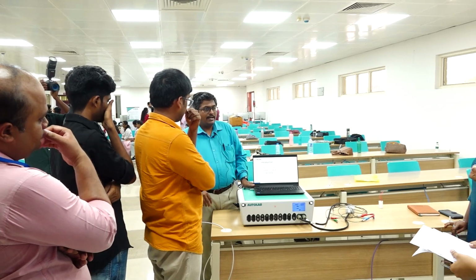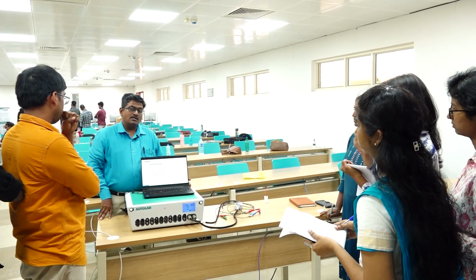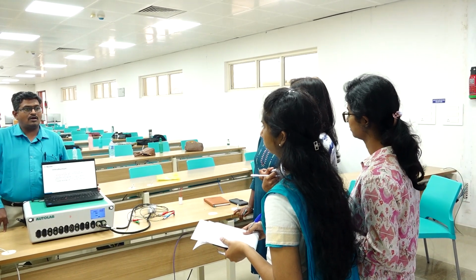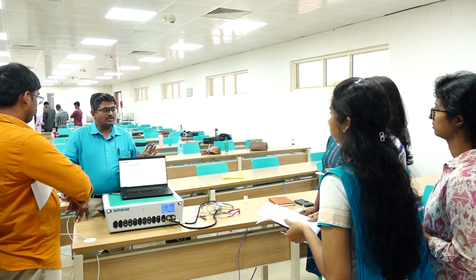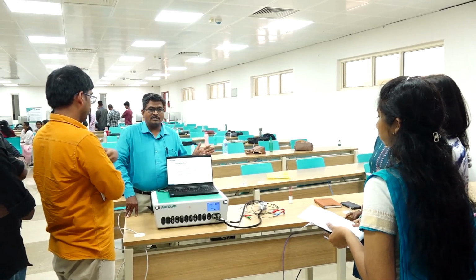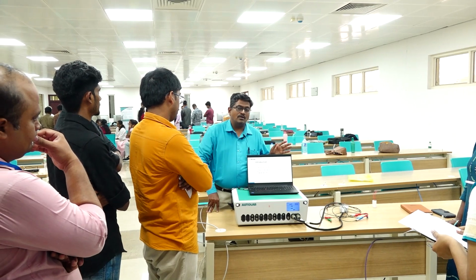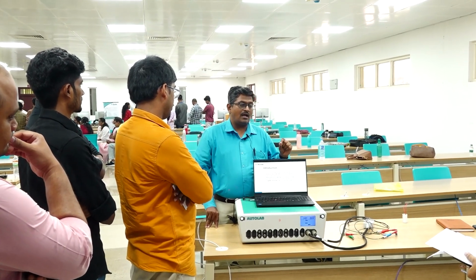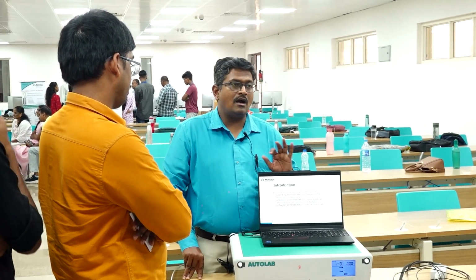So, how do we study this reaction? We need an electrochemical cell. This electrochemical cell consists of a 2 electrode, 3 electrode or 4 electrode setup. The common one we use is the 3 electrode setup, which has a working electrode, reference electrode and counter electrode. We apply the potential between working and reference and we measure the current between working and counter. This is the common phenomenon in all electrochemical workstations.